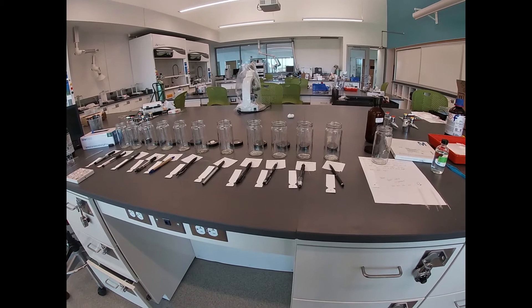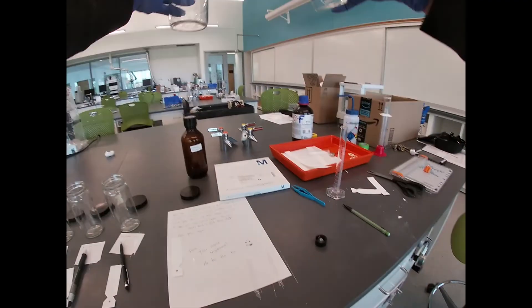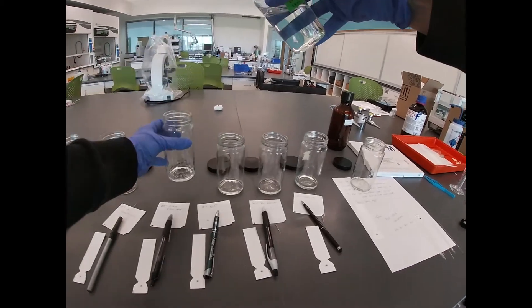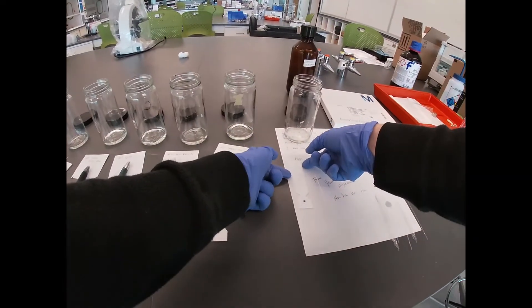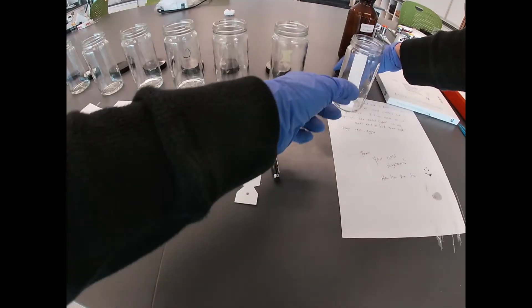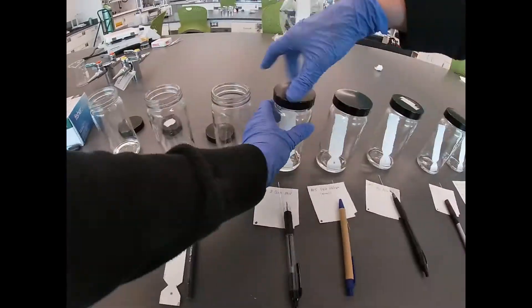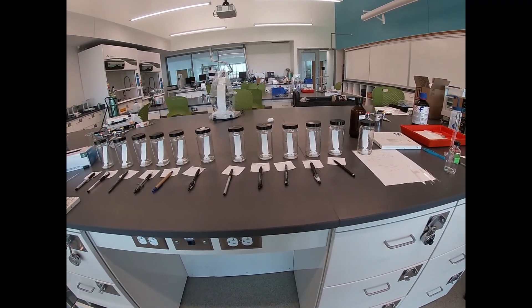So now we have them all spotted. Now we're going to pour solvent into all of the jars, making sure we cover the whole bottom. We want our spots to be above the solvent line. Our solvents are in. Then we take each of our samples, drop them in, lean them against the edge, and cover. We're going to let these migrate up and then see what we see.